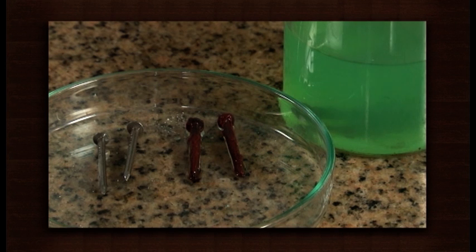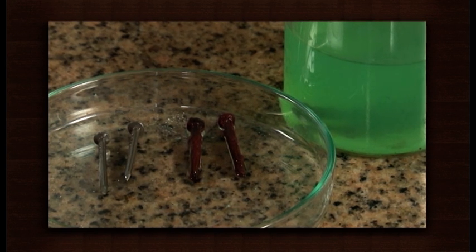The nails therefore changed to the color of copper while the solution showed the characteristic green color of ferrous sulphate.